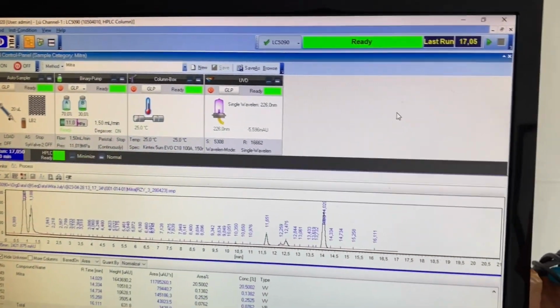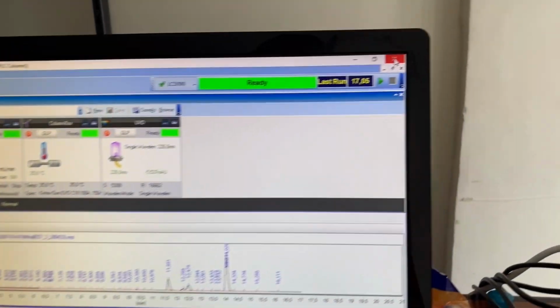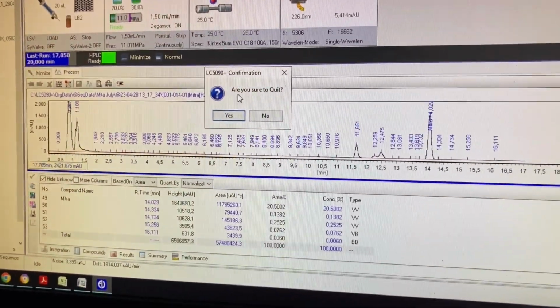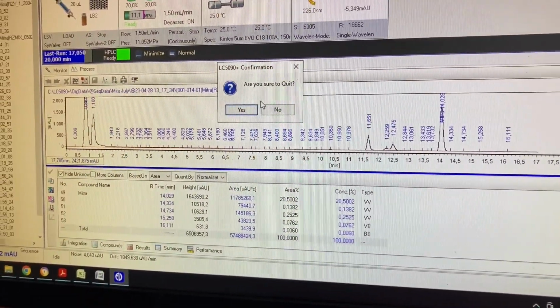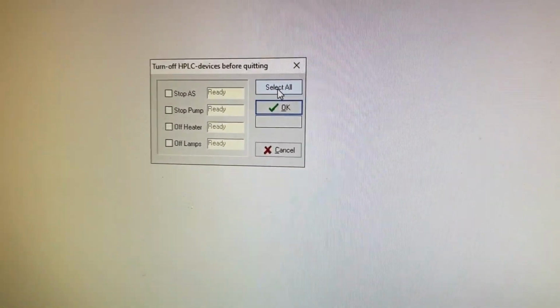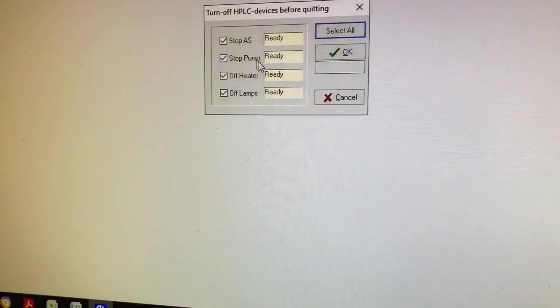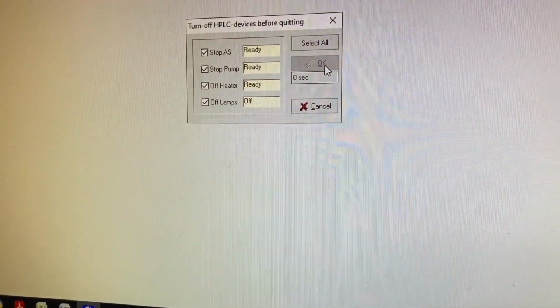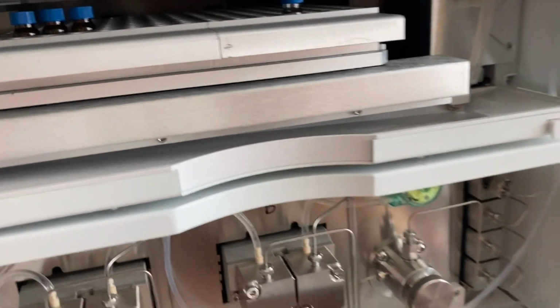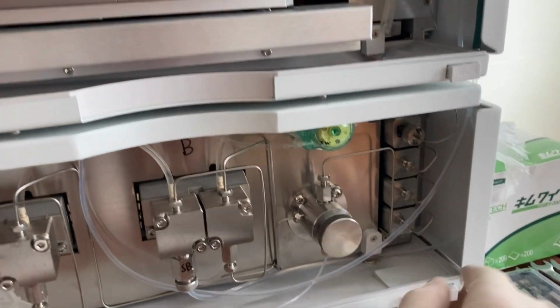So done a couple of tests, we're going to shut the machine down. Just click there, the corner, and it says, Are you sure you want to quit? Yes. Select all. Okay. And we shut the software down before we turn the machine off. And then just have 5 switches.